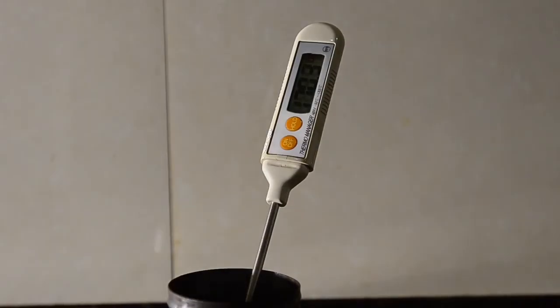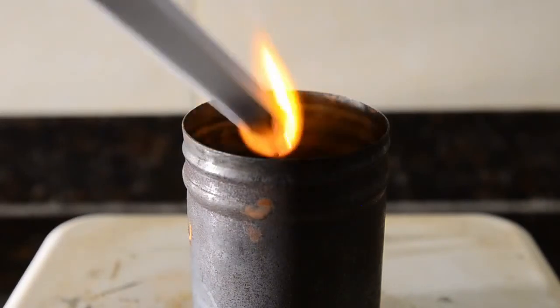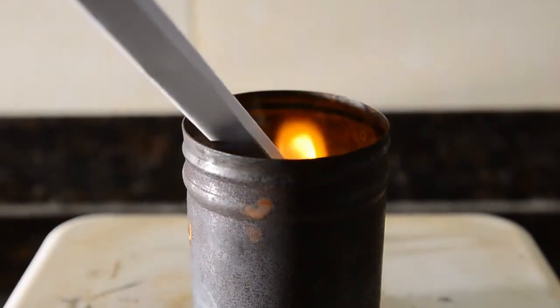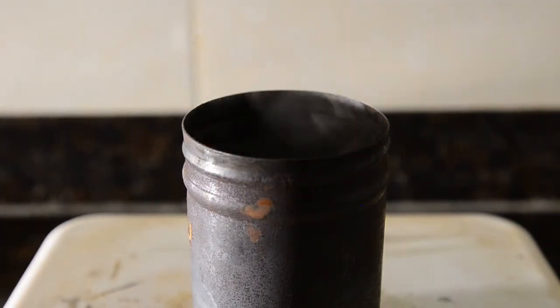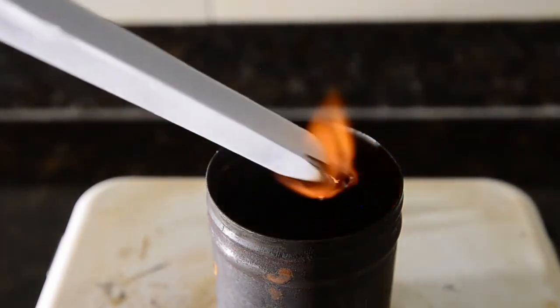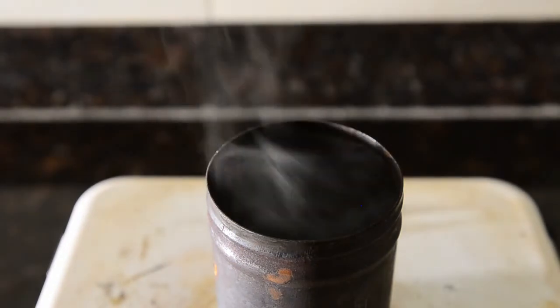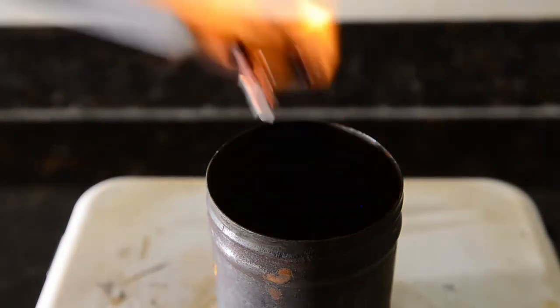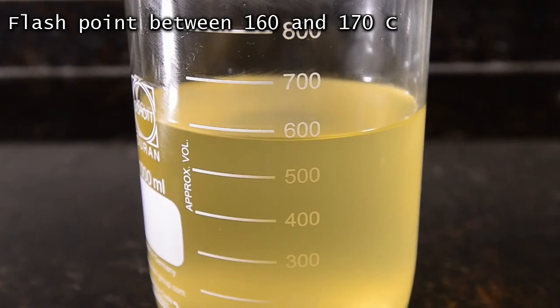170 degrees C. That sounds like a flash. Let's try again. We didn't show you one of the tests, but the flash point of our product is between 160 and 170 degrees C. This is about right.